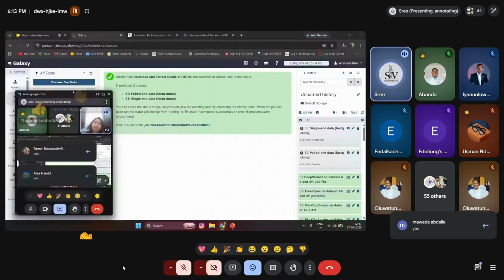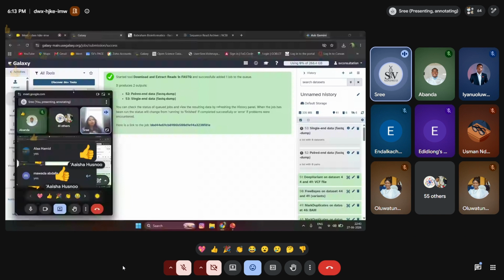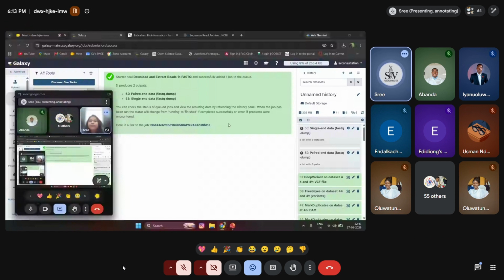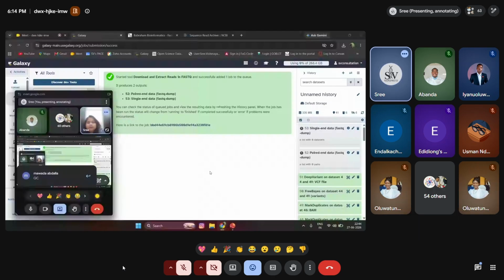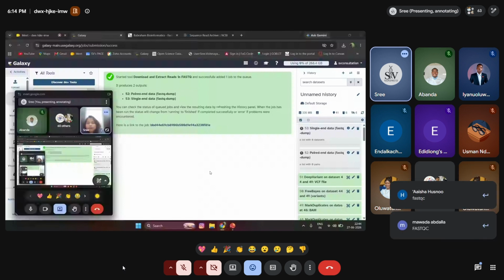Nice. Okay. Once the data is loaded over here, the main thing to do with the FastQ file, which is what we're going to learn, is the first step: QC. Yes, we are going to do QC. What tool are we going to use right now? Yep, it's the FastQC tool.